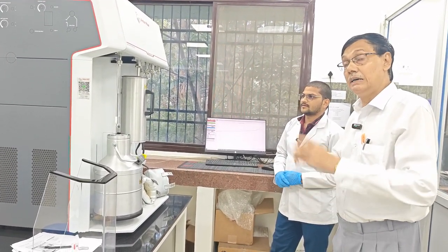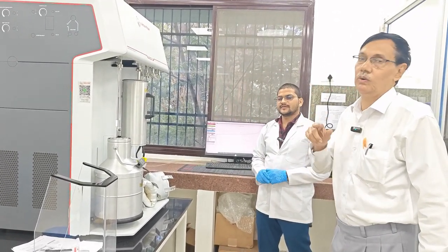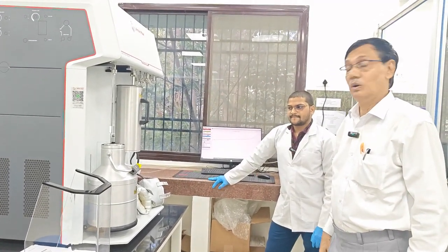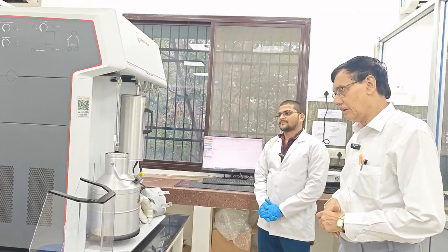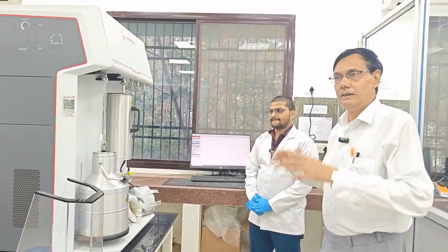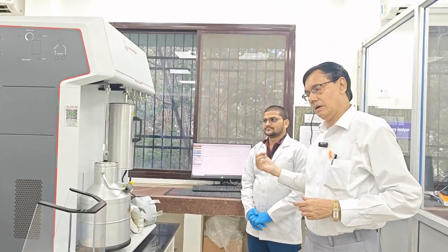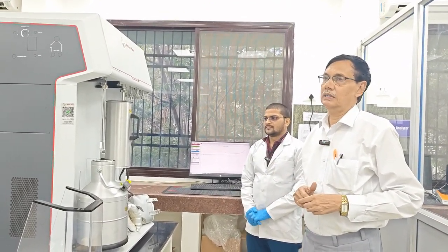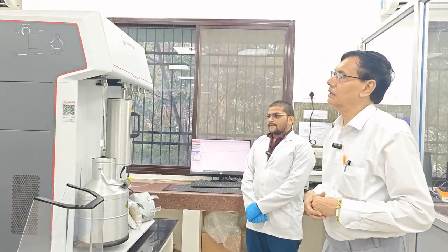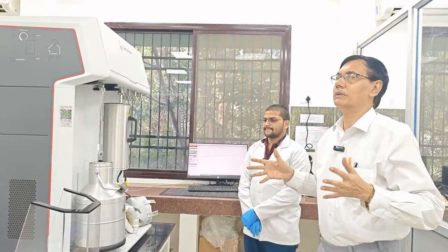It is really a great discovery by the three great scientists, Brunauer, Emmett and Teller. Therefore it is called the BET equation, and it was discovered in 1938. I am really thankful to the head of the department, Professor Dev, who is also coordinator, and you can see the instruments and other things. I am also grateful to Dr. Rajiv Nayan, Dr. Indrapal Kharwal, Vaibhav Dikshit and Abhishek Katendra for demonstrating, and it is only for student purposes.